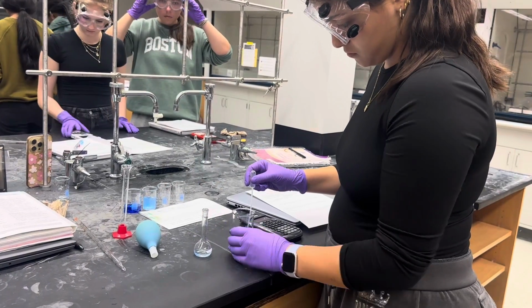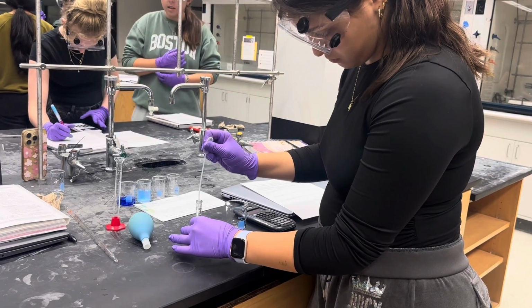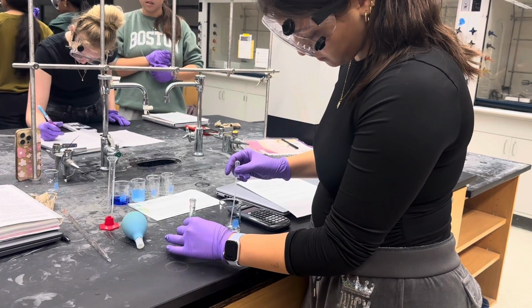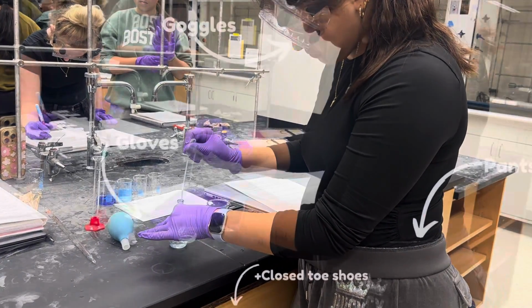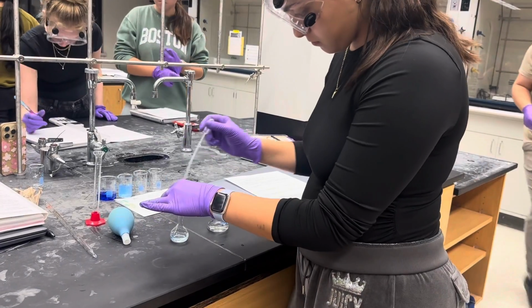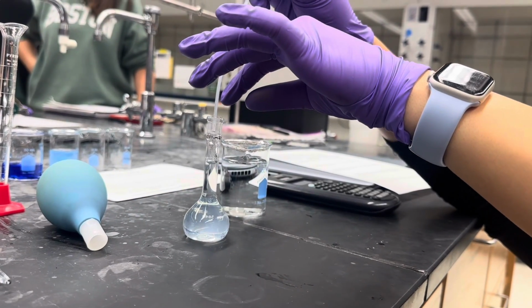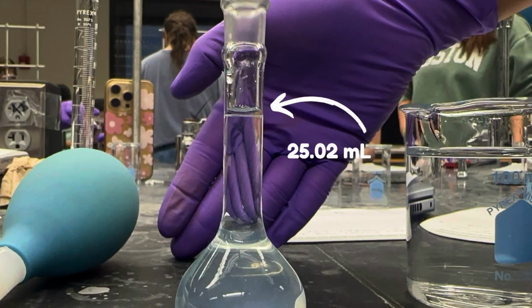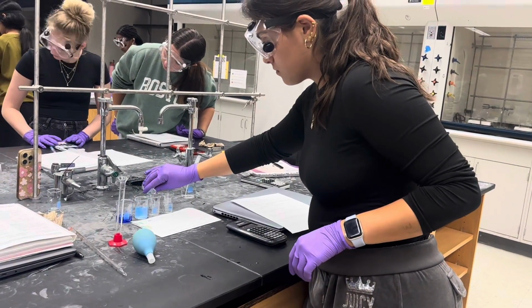Slowly add distilled water using your transfer pipette until the bottom of the meniscus rests exactly at the 25 milliliter mark. Also, before beginning any laboratory experiment, make sure you are wearing proper safety attire. Once your volume is verified, transfer this second dilution into another clean beaker.